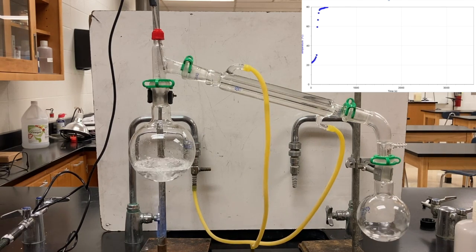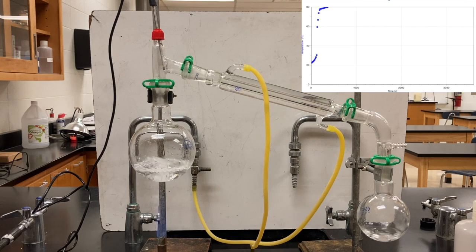Back to normal speed. You can see that there's a liquid dripping now into the cold end of the apparatus. And that liquid should be whatever boils at the lower temperature of this mixture.